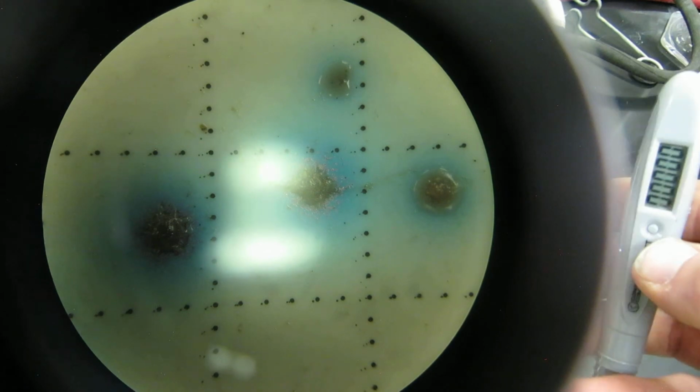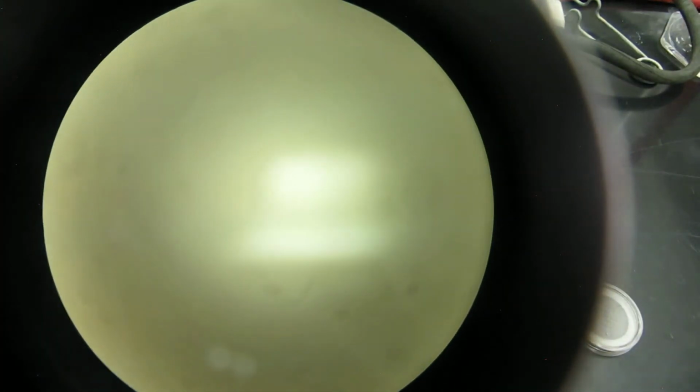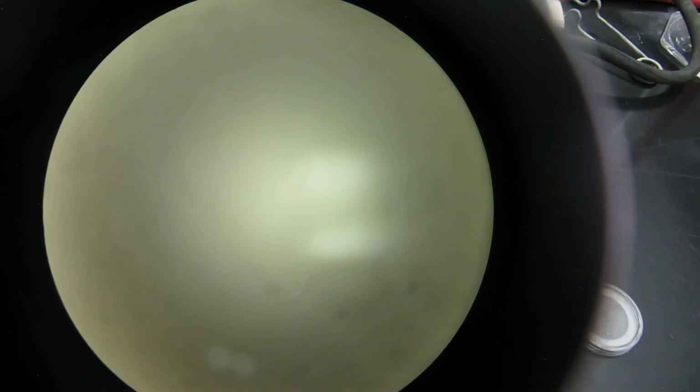We'll press reset, and then you can go in the plate, and each time you press one of these, it beeps. And then you actually see that it counted 4 right there. It's kind of hard to see. There we go, 4. So that way you can count as many as you want and just beep away. And then a good thing is that it actually marks the plate when you count, so you can see that you already counted somewhere. Like I just drew that line and it marked it. So you don't have to recount it, which is nice to keep track. It's not impossible to count it manually either. Sometimes I like to use a Sharpie and just press that when I count it.